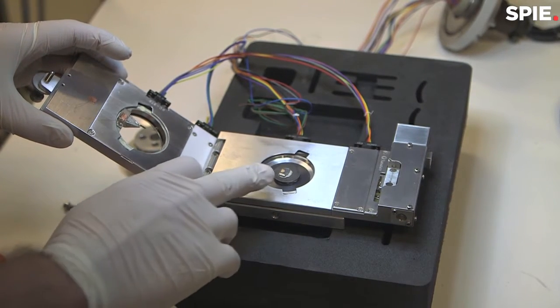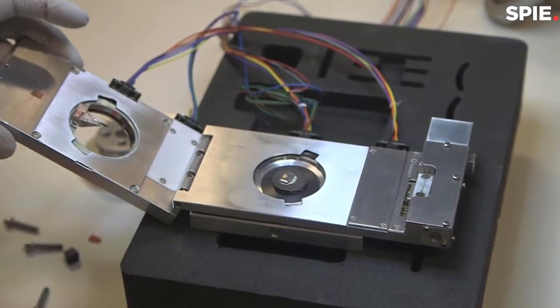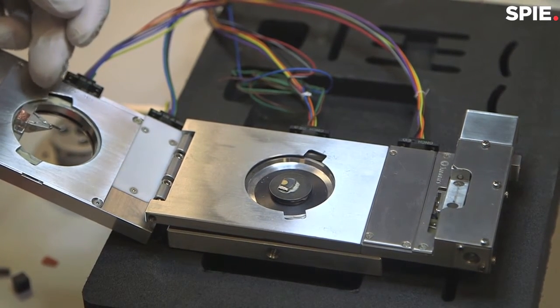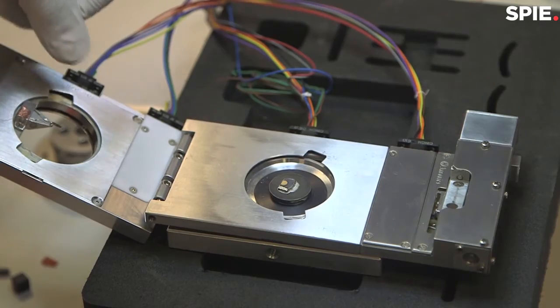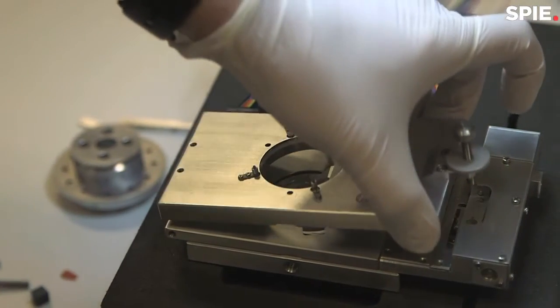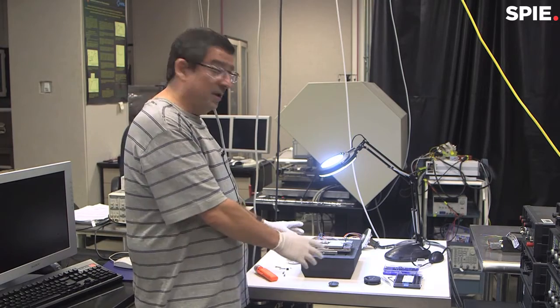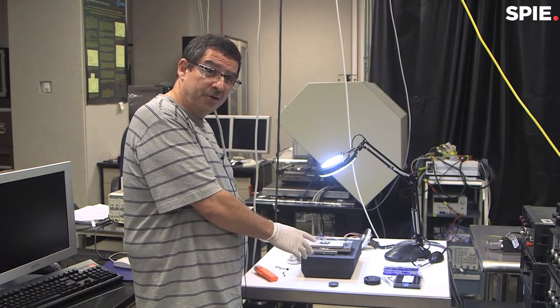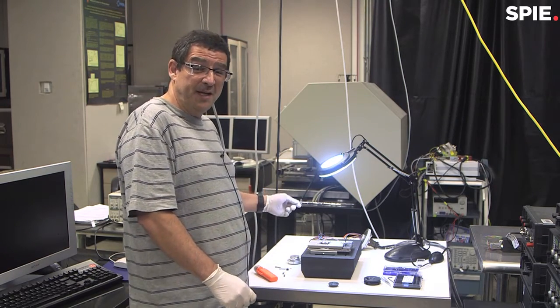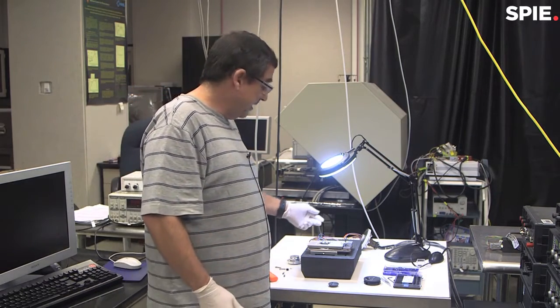Here is where we have the sample — in this case a cadmium telluride sample, a very common material for photovoltaics. Right now we just have an AFM tip, but when we do transport imaging we use a fiber optic probe. We place the stage over the sample, and at this stage we are going to install it in a scanning electron microscope. The electron beam will be used to generate the carriers, and to detect the light from the recombination we use the NSOM.